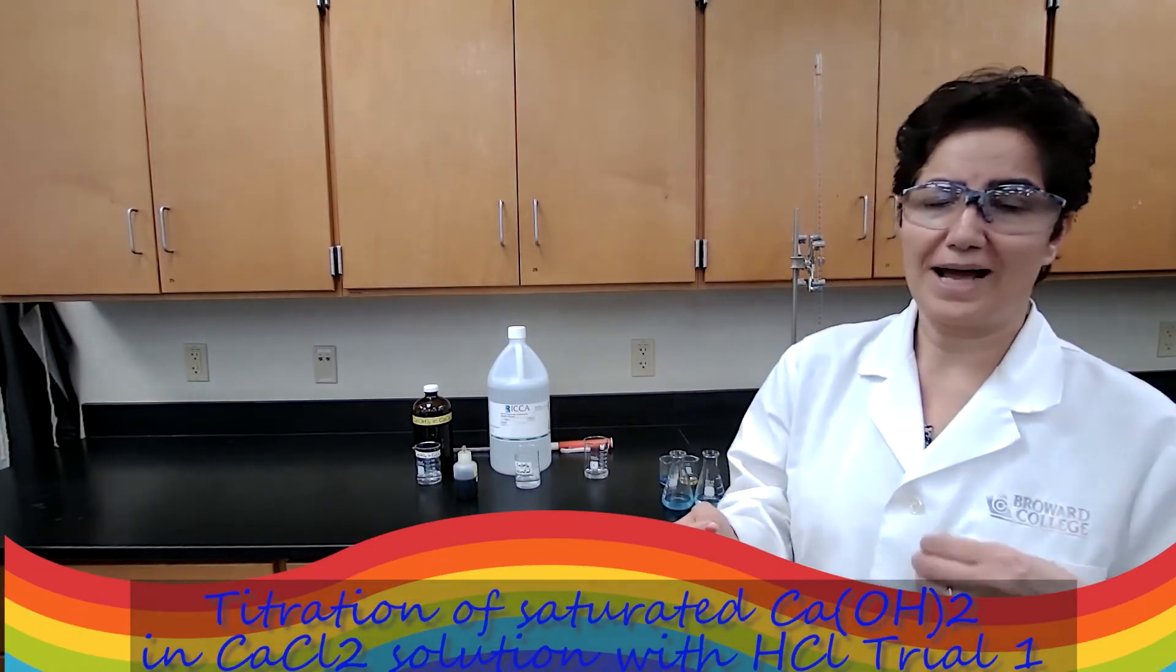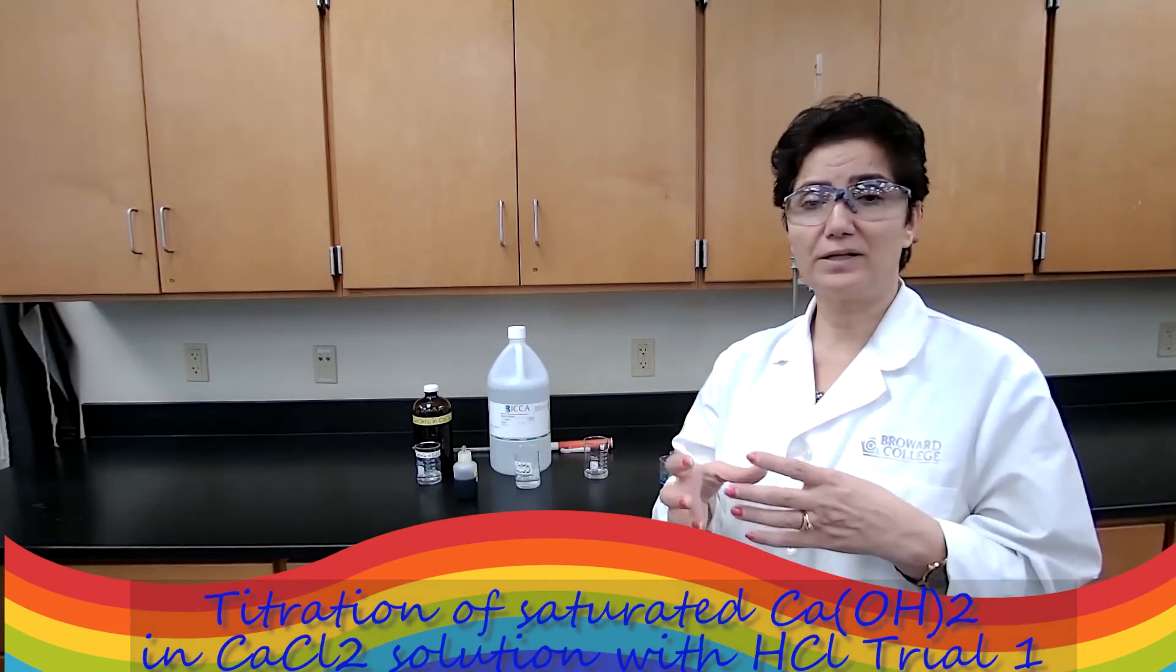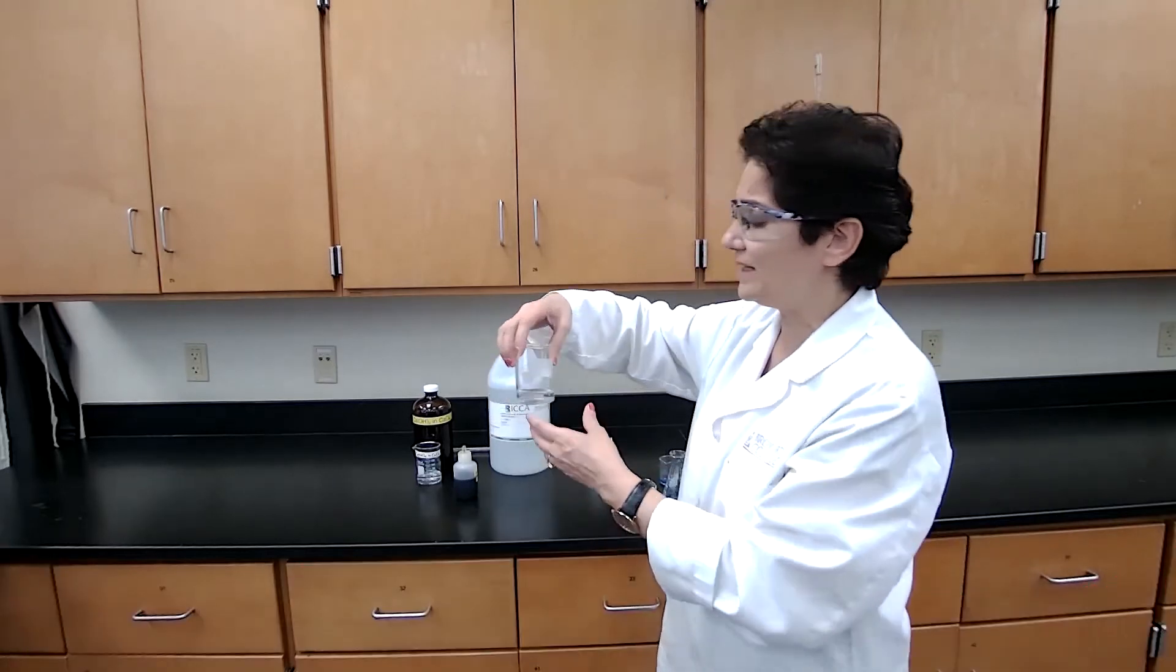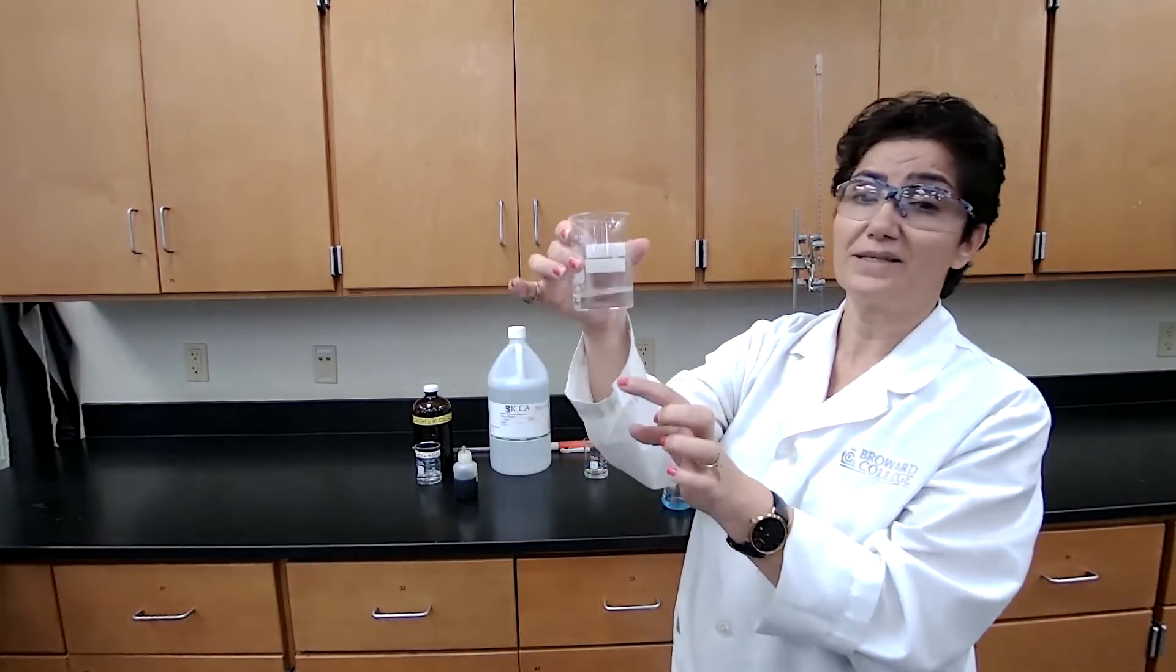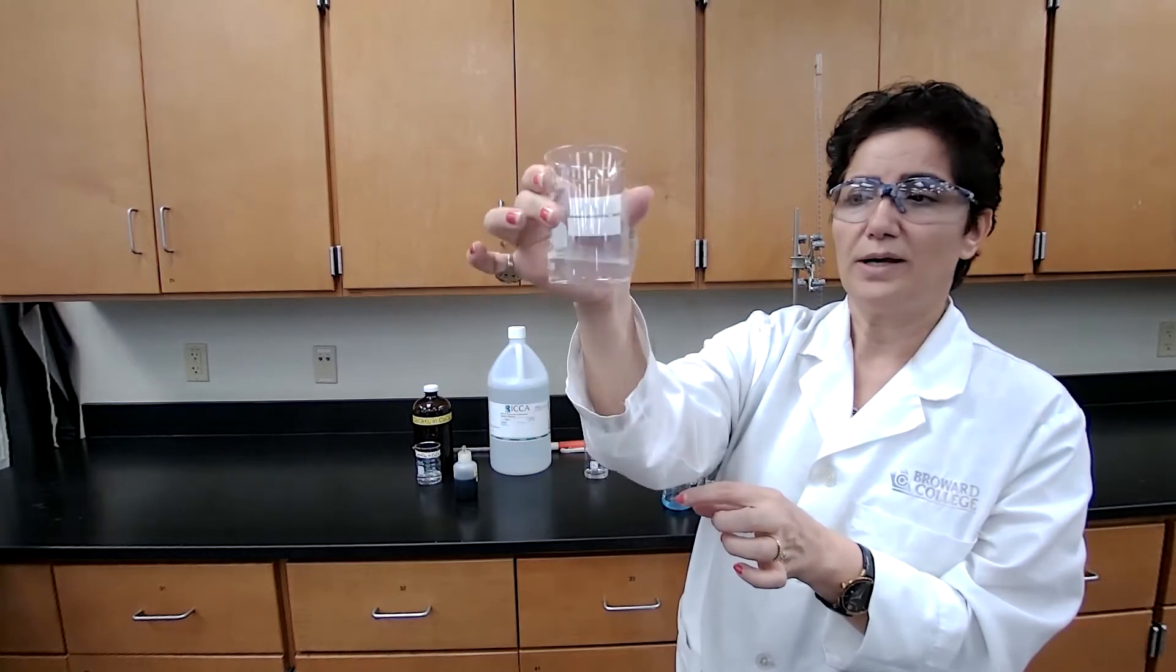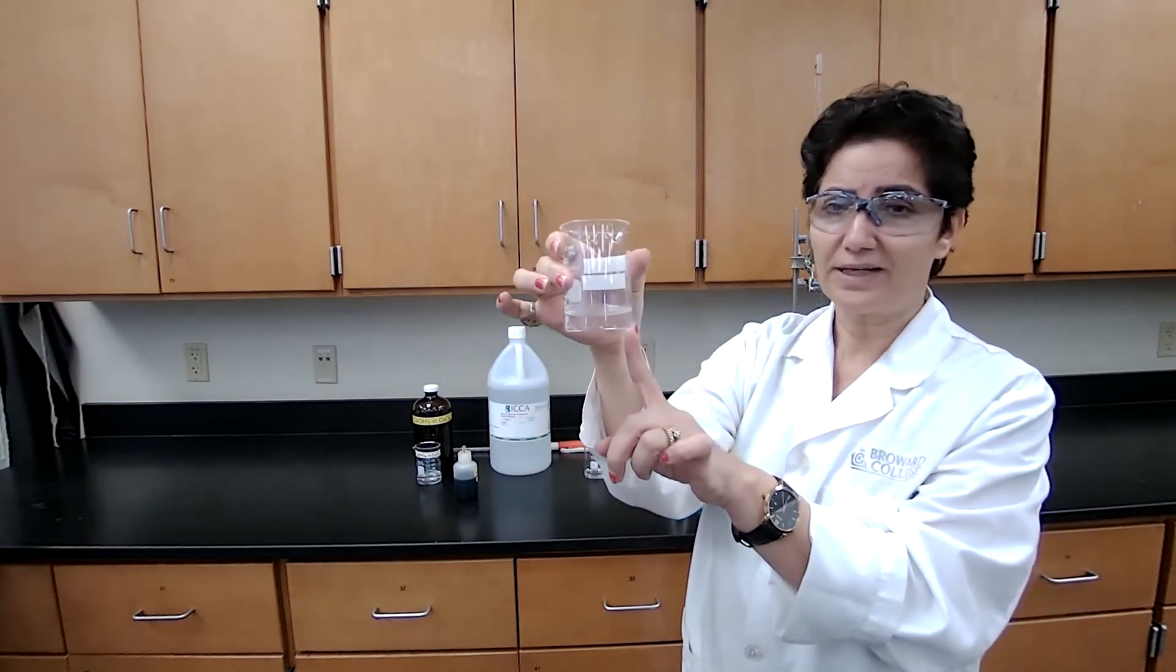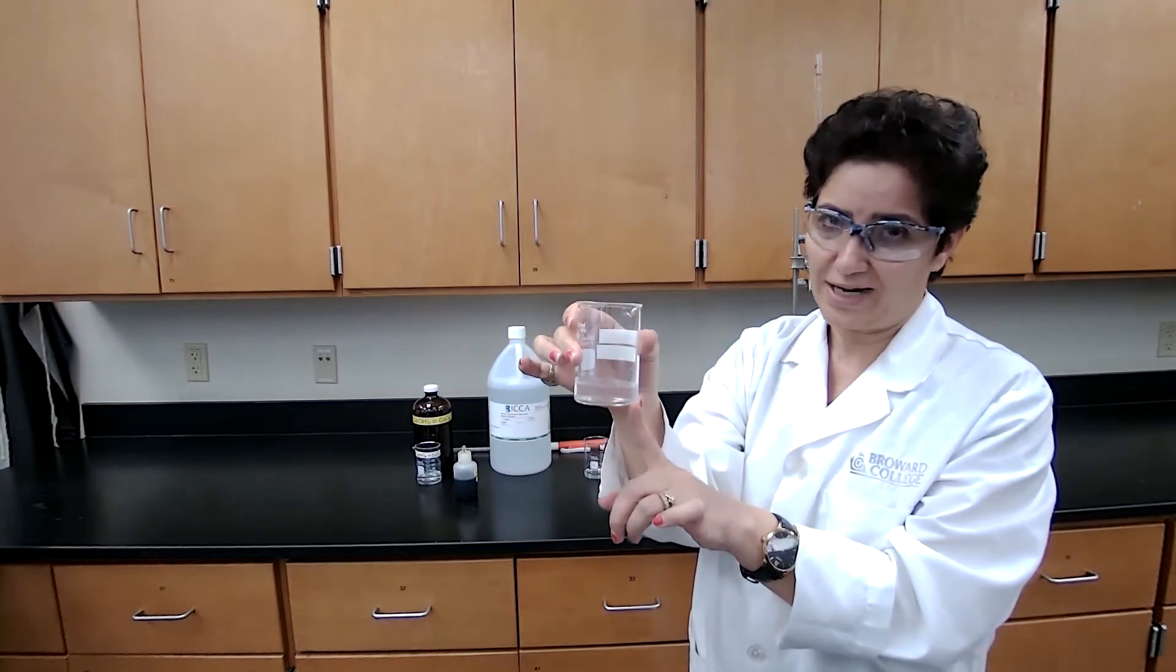The lab manual asked for filtering the solutions. So since the solution was filtered already and it did look clear and there was no residue, I did not show that step also.